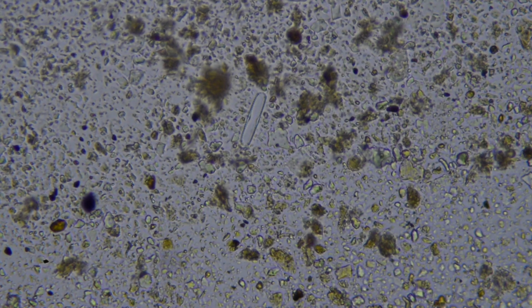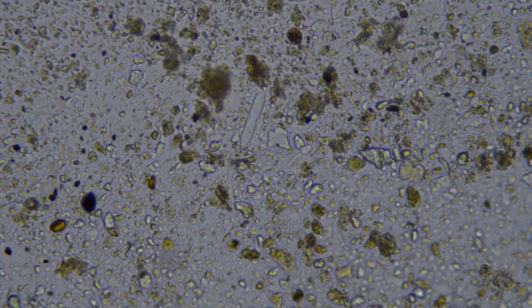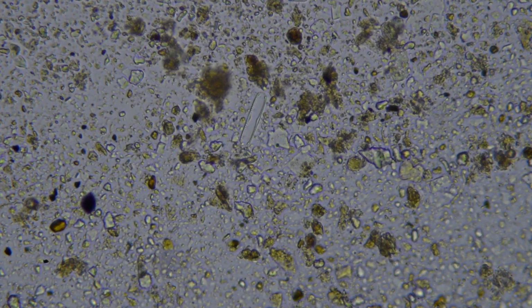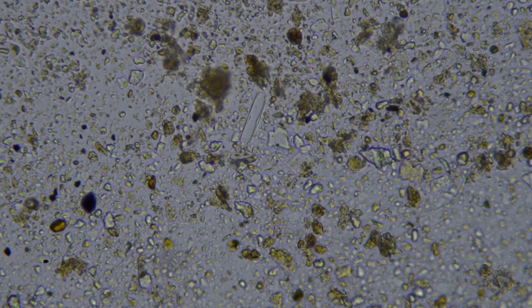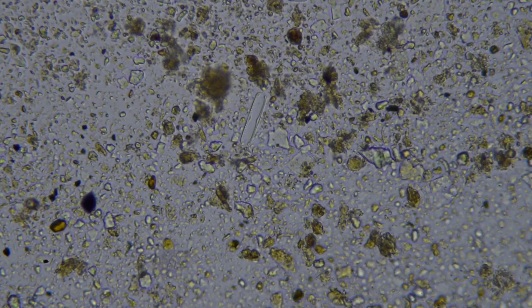That little transparent plate there in the center, that's a bit of silica. So that's a bit of sand. The lighter honey-coloured little aggregates that you see spread around, they're actually fulvic and humic acids. So that's a good sign. That is a sign that there's definitely been historic fungal activity.